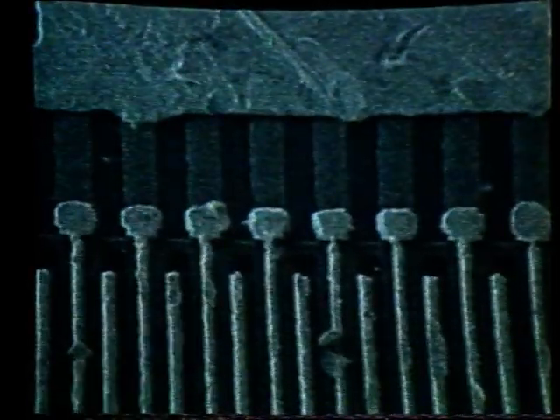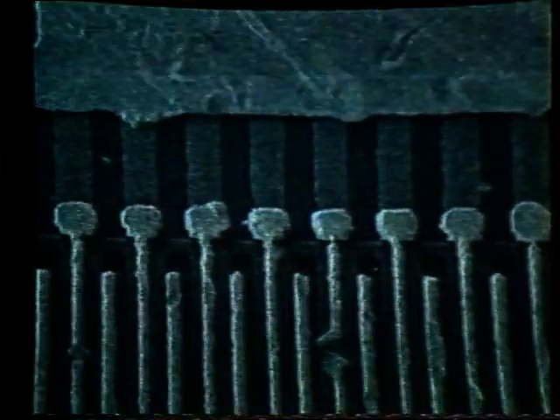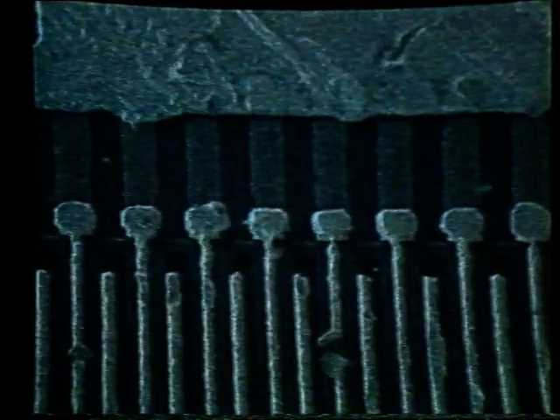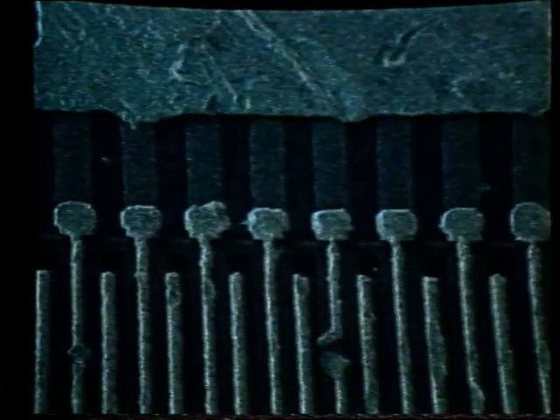It would now be easier to correct for this slight movement that we are seeing at a higher magnification. Going back to function key number 2, we'll stop the rocking of the condenser lens, allowing us to activate magnification. Let's enter a magnification of 10,000. Position a feature to the center of the screen, and now reactivate the rocking of the condenser lenses with function key number 3. Notice it is much easier now to see the movement.